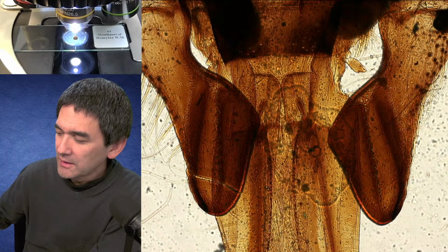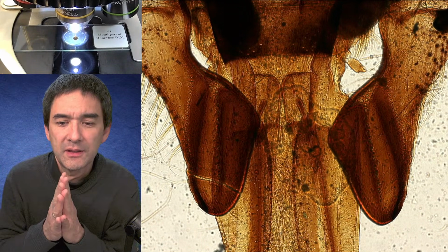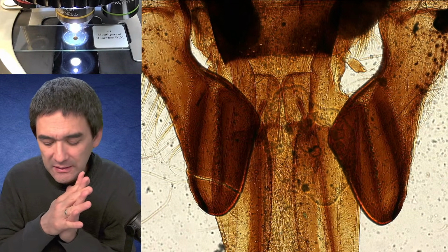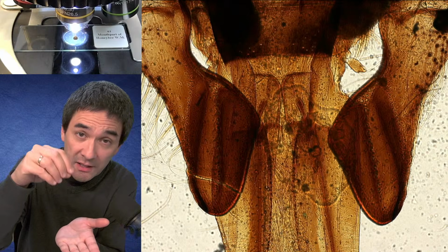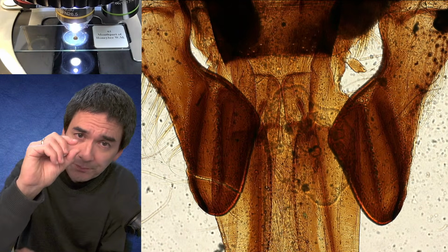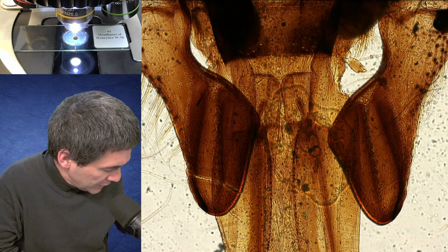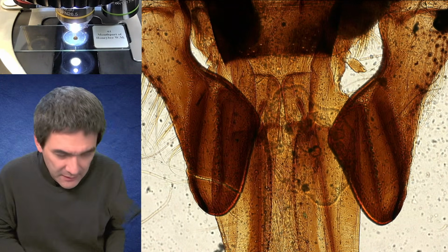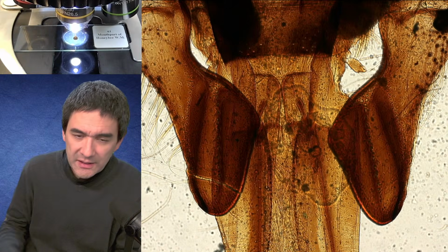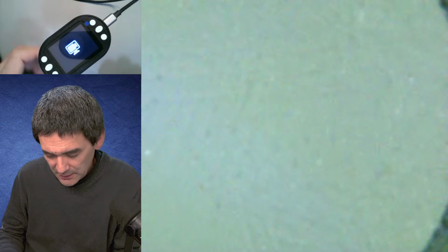And this is also a question. There are simply some physical limits to this. With optics that are so far away from the slide, you simply cannot get the resolution. So in order to get clarity, you have to be very close to the specimen. I would like to show you a couple of other things here. But still, it's a nice thing to have in order to play around with, right?